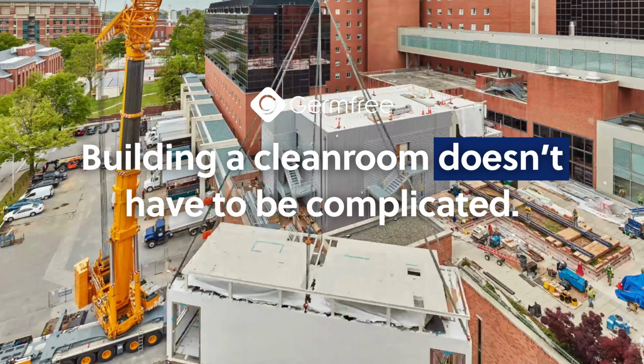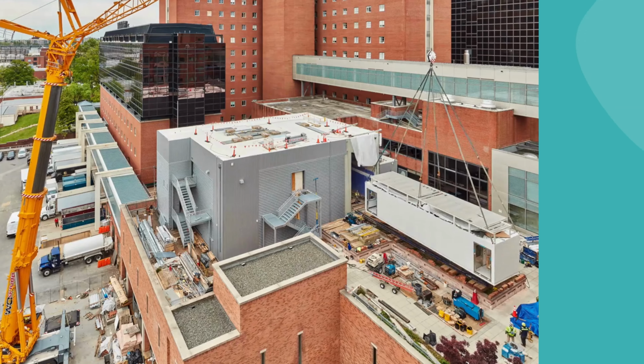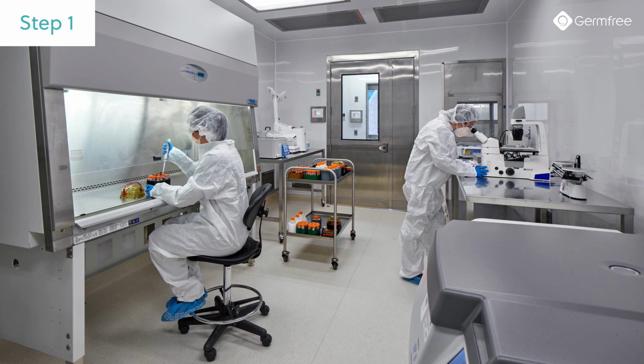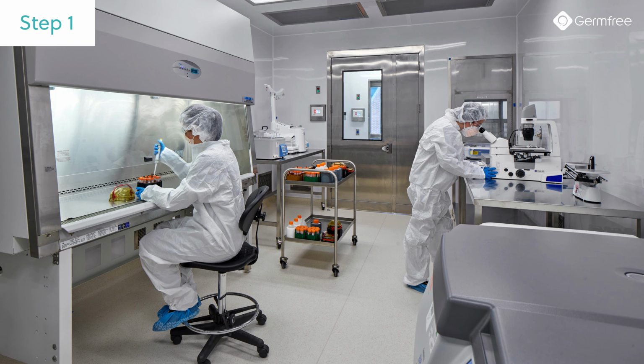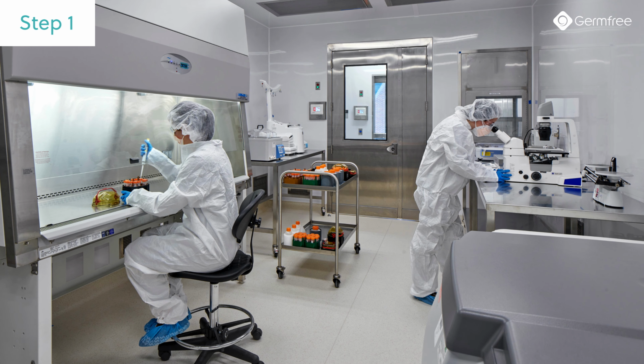Building a clean room doesn't have to be complicated. Here's how Germfree simplifies the process. Every Germfree project begins with conceptual design and clearly defining user requirements. From process flow and cleanroom classification to system performance, Germfree starts by understanding exactly how your facility needs to function.